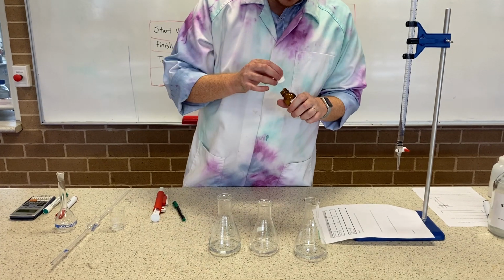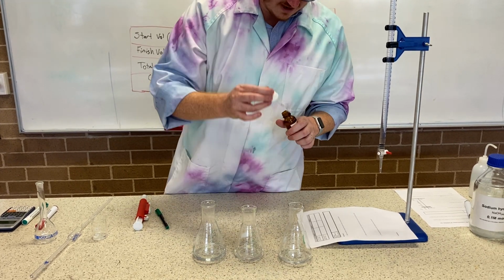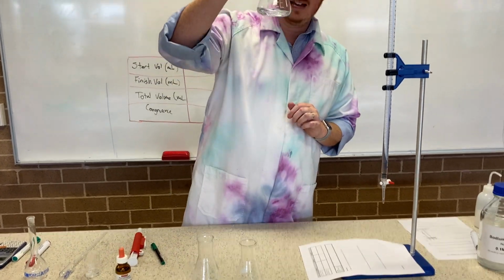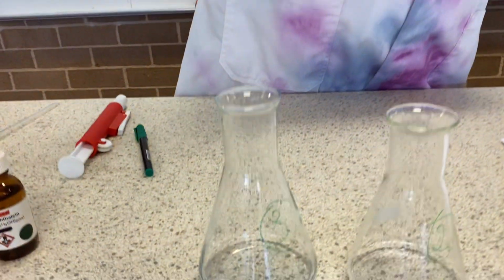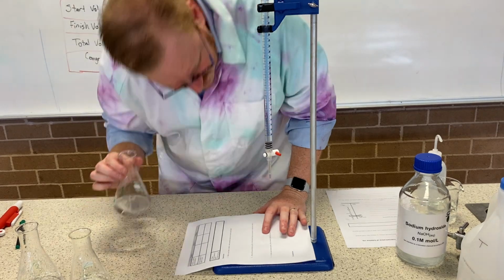That's good, it's nice and clear. 2 or 3 drops is the best estimate with phenolphthalein. It's a nice bright endpoint. Some other indicators you may need a little bit more, but you want to limit it. Okay, I've labeled these number 1, number 2, number 3. Don't know if you can see it there, it's hard to see in the green texture. But that's okay. So I'll put number 1, it just helps me keep track.